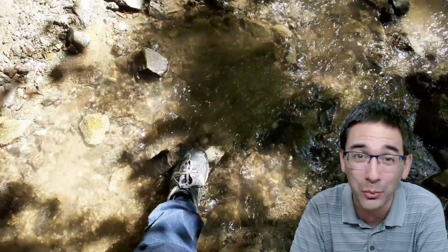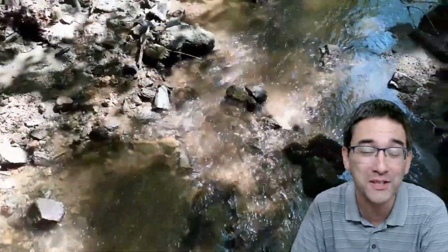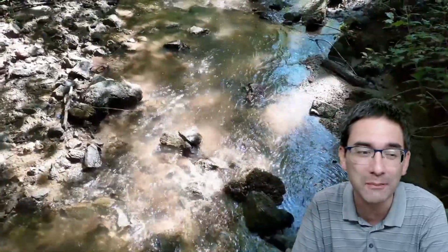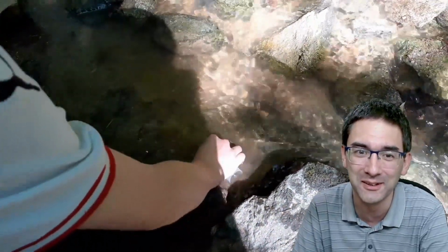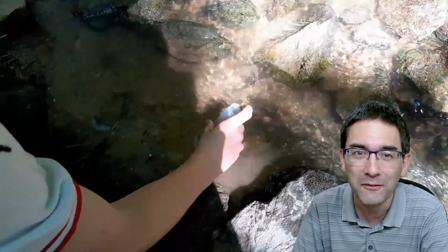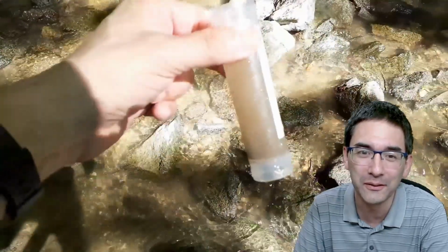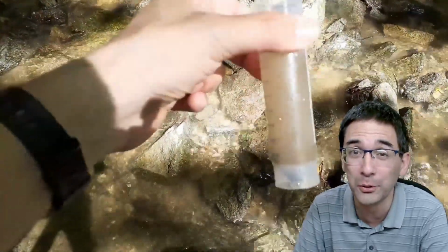I'm still going to show you what I found, and later on, in a small little pond, I was way more successful, and I think I also have an answer why I was not really successful in finding many interesting water microorganisms here. So this here, that's not me taking a sample, it's my son. He should get his feet wet, not I. And we collected a little bit of this sediment, put it into a tube, and I took it home to put under the microscope.